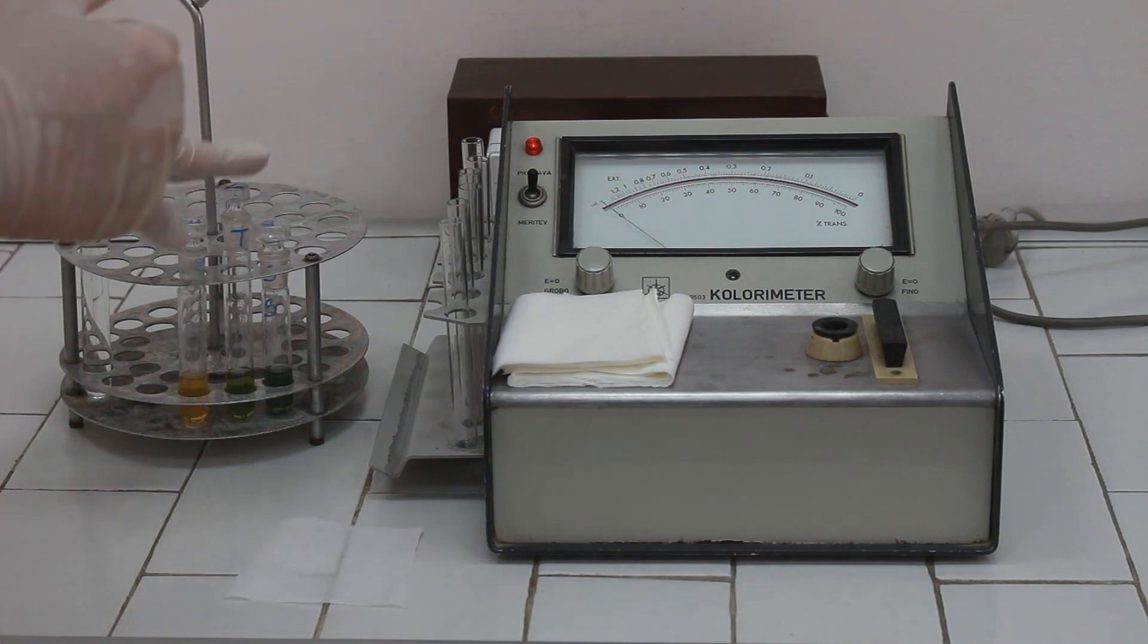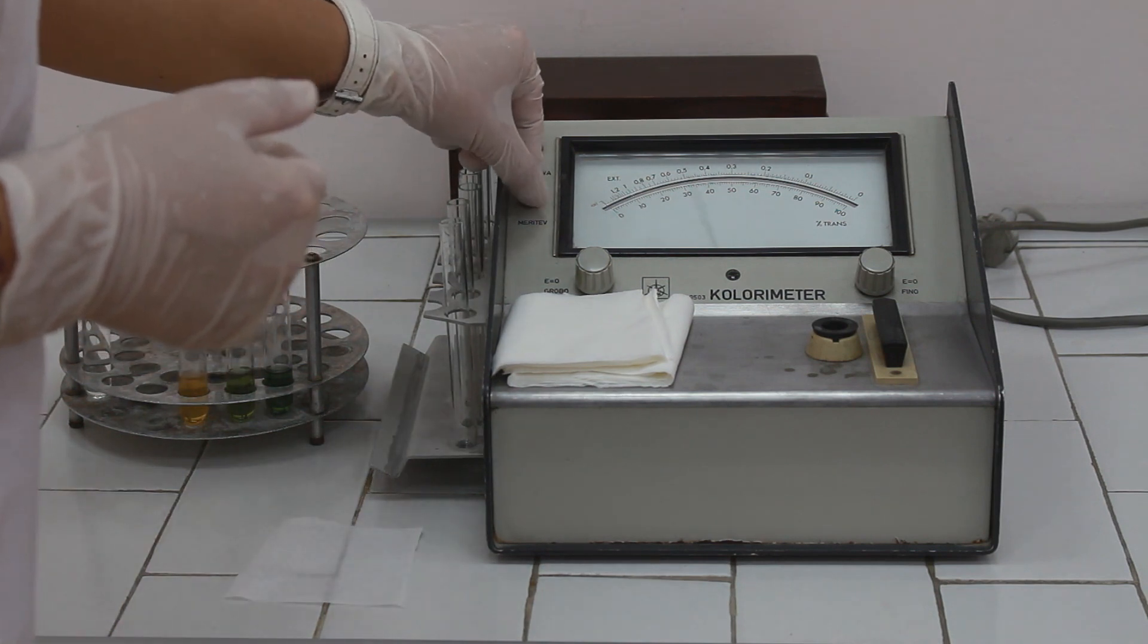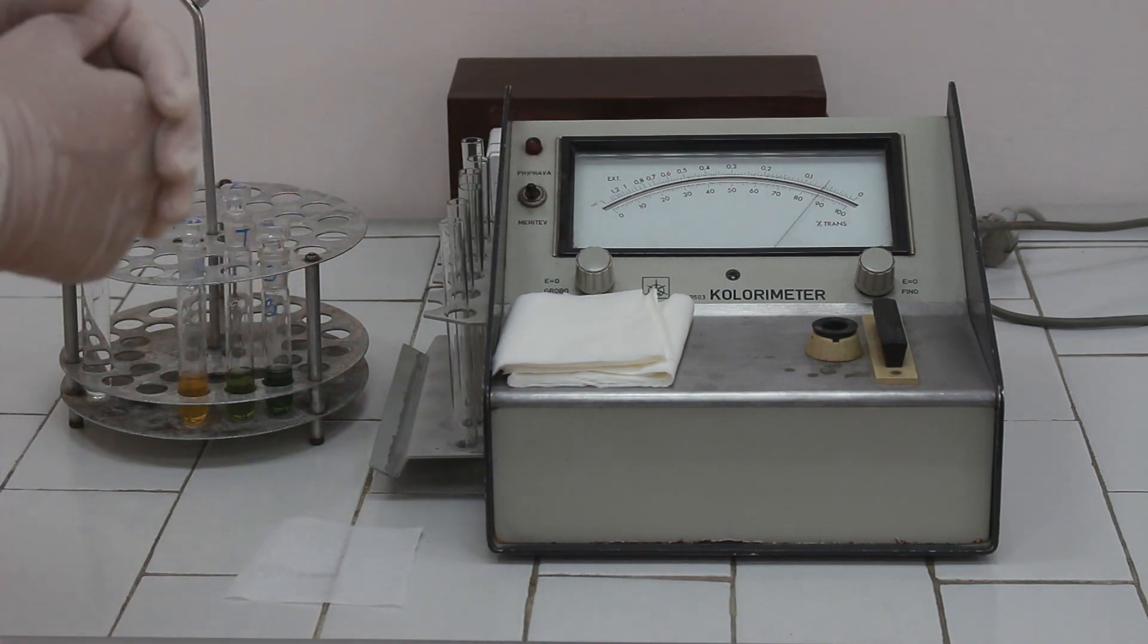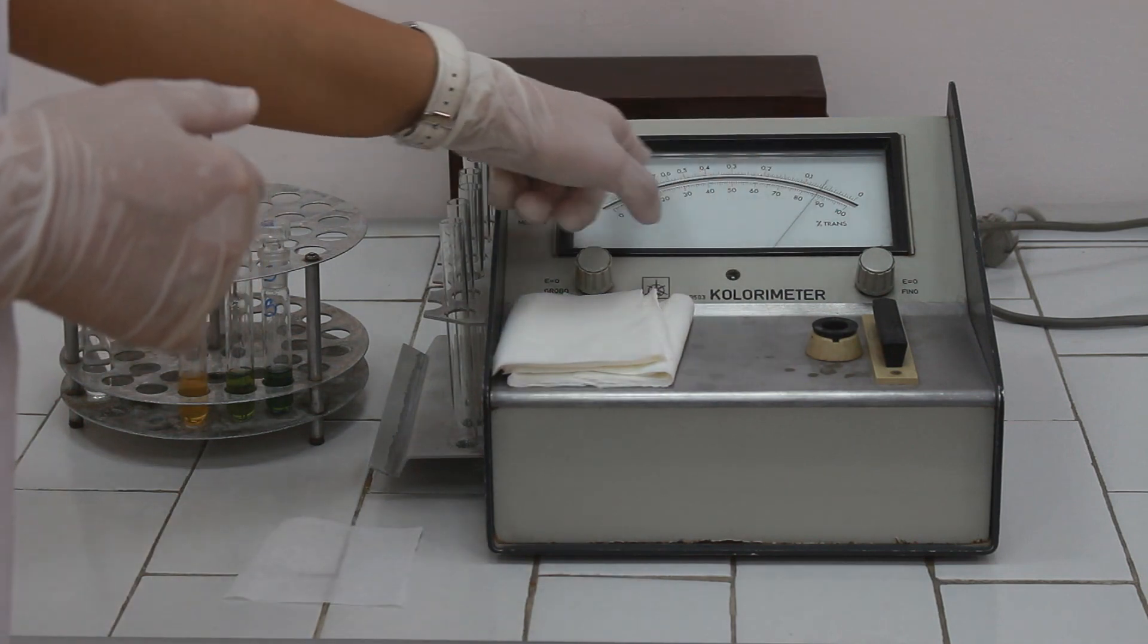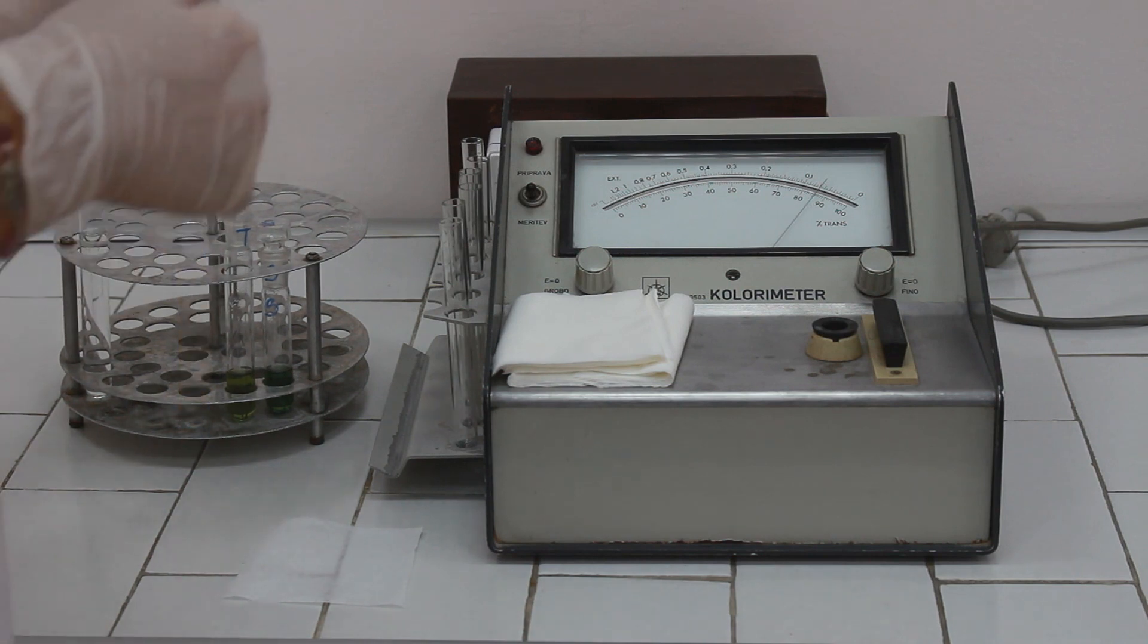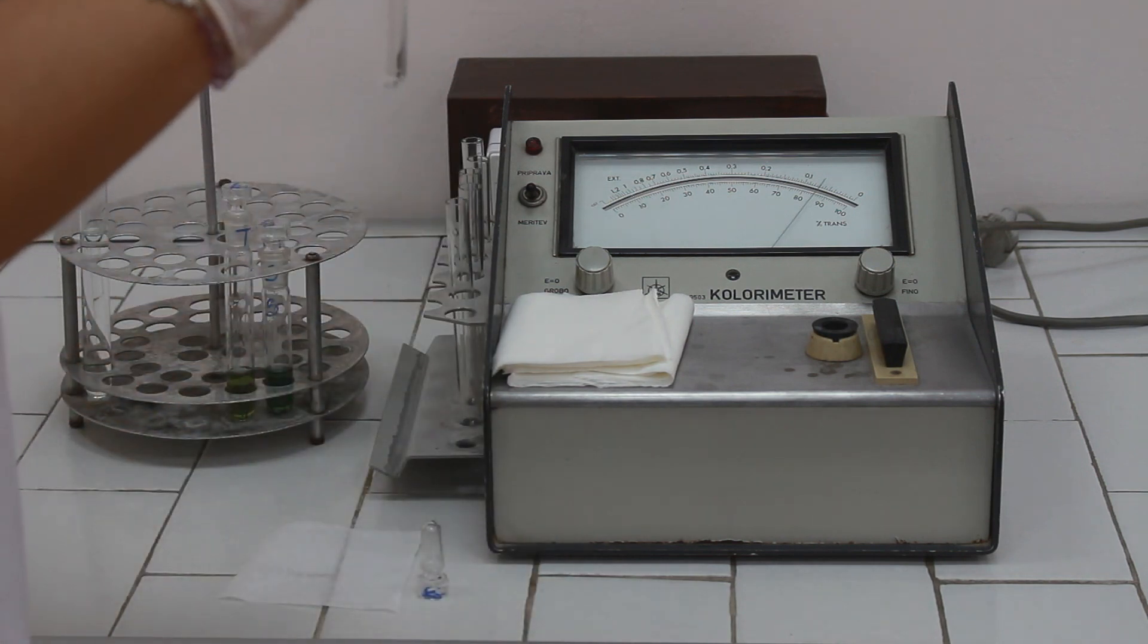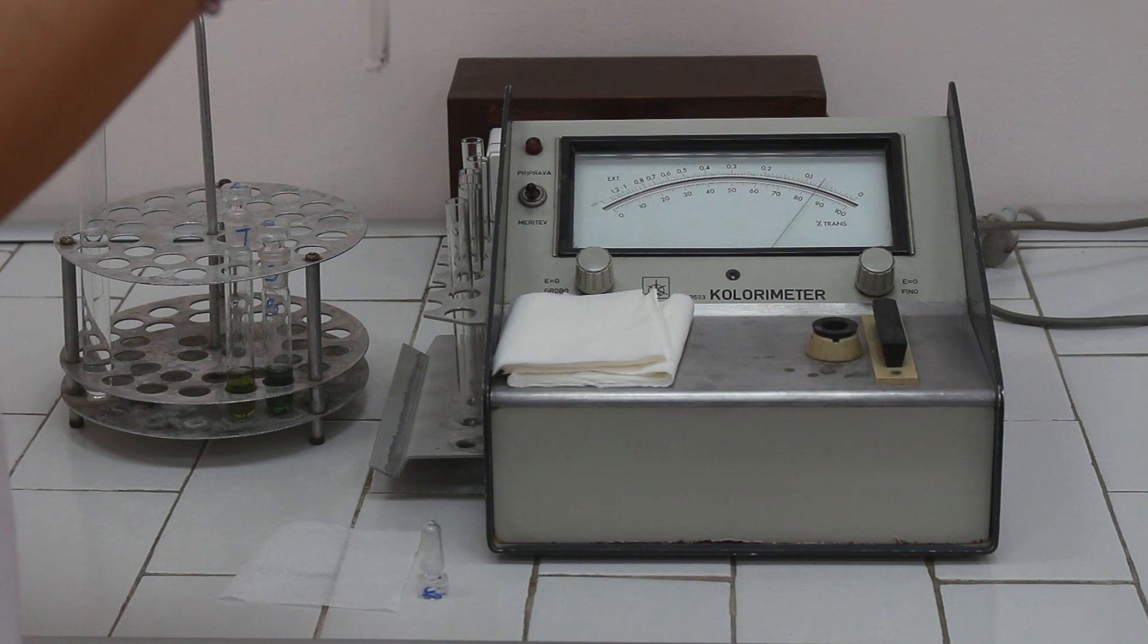So what we need to do is to get the instrument ready for the measurement. And we are interested in following the upper scale which actually measures the absorbances. We are going to take our blank solution and pour it to the cuvette which are made of glass instead of plastic.